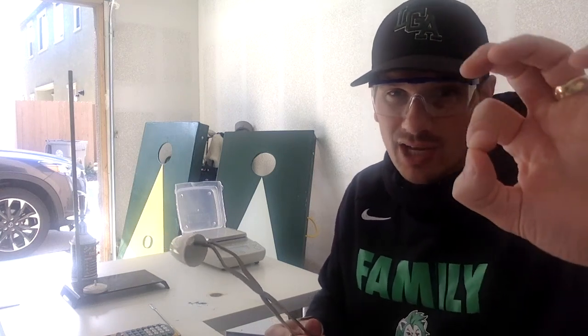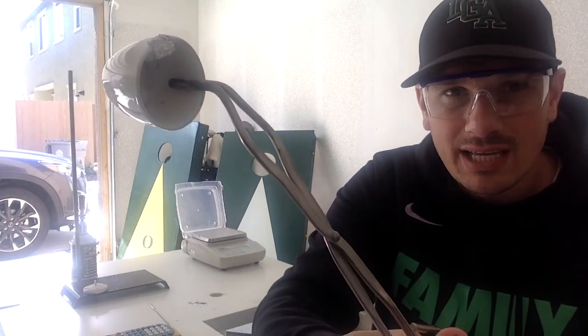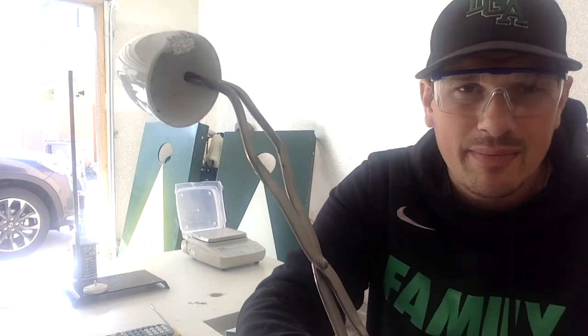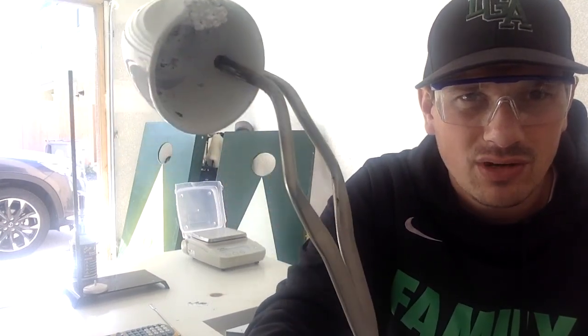But I want to show you guys what the product looks like, because I showed you guys the magnesium strip. Here's what the product looks like. So you can see that right here, it's super duper hot. I'm going to point right here. Right here is the magnesium oxide. If I can get a little bit closer, you can see that product in there. Look how gross that is.